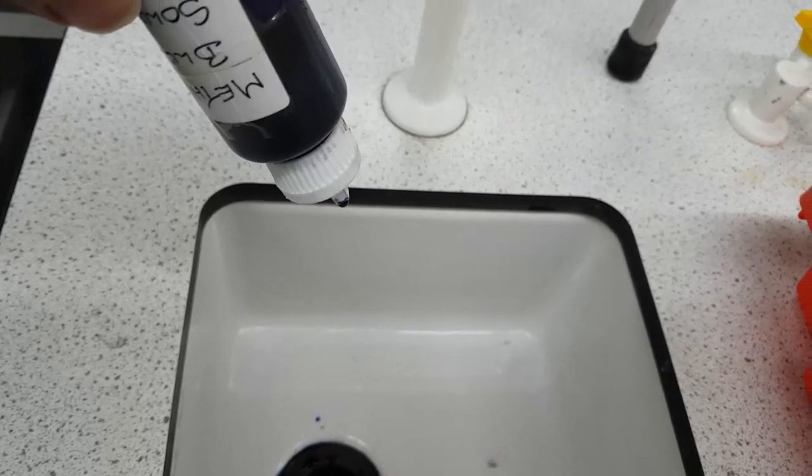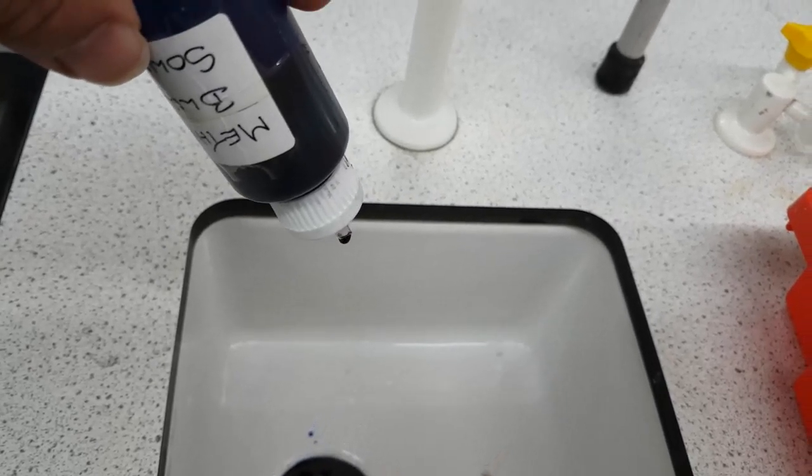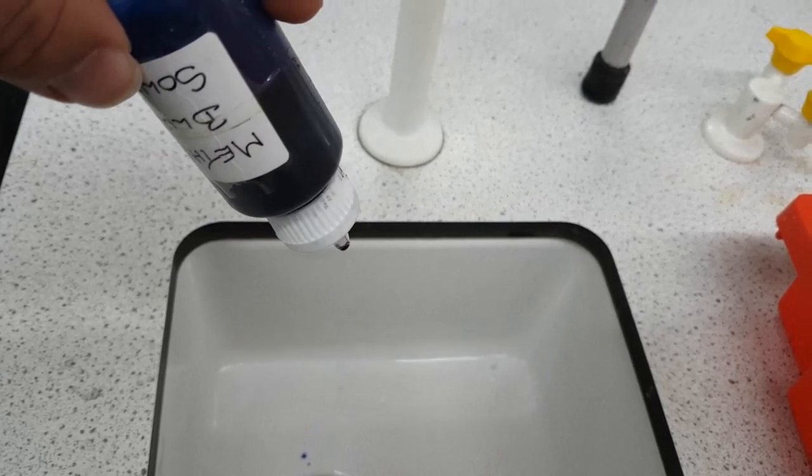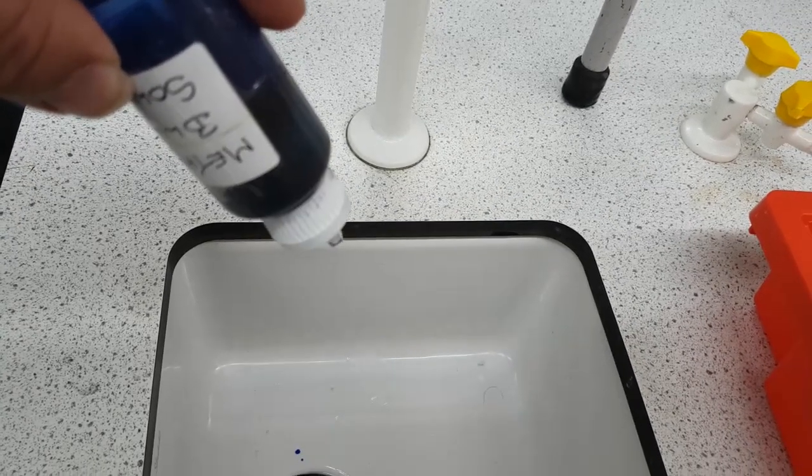So literally I've tipped it upside down and you can see that there are drops coming out and it's a nice steady drop rate. So if you just squeeze a tiny bit and just get practicing how much you need to squeeze in the sink.